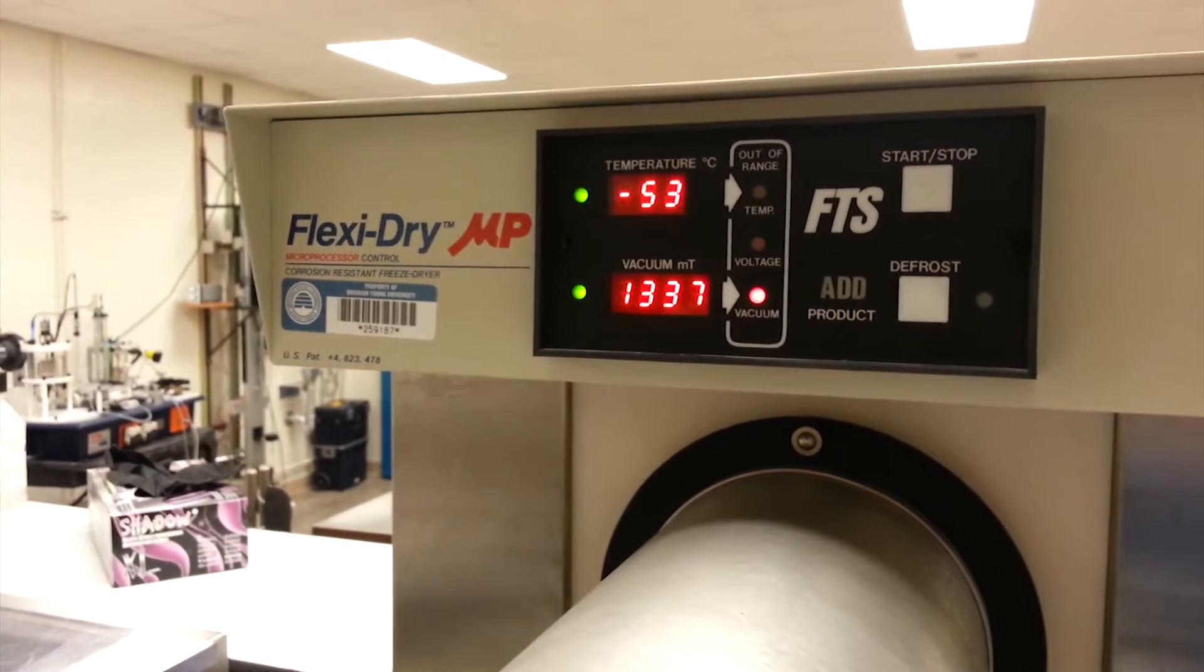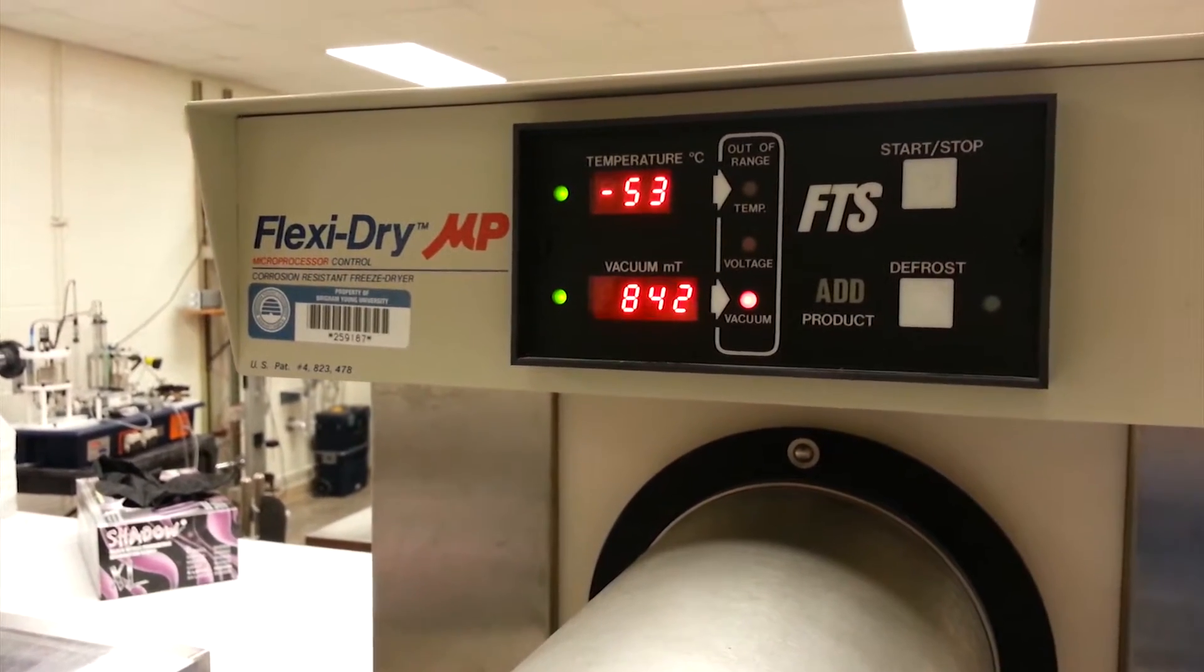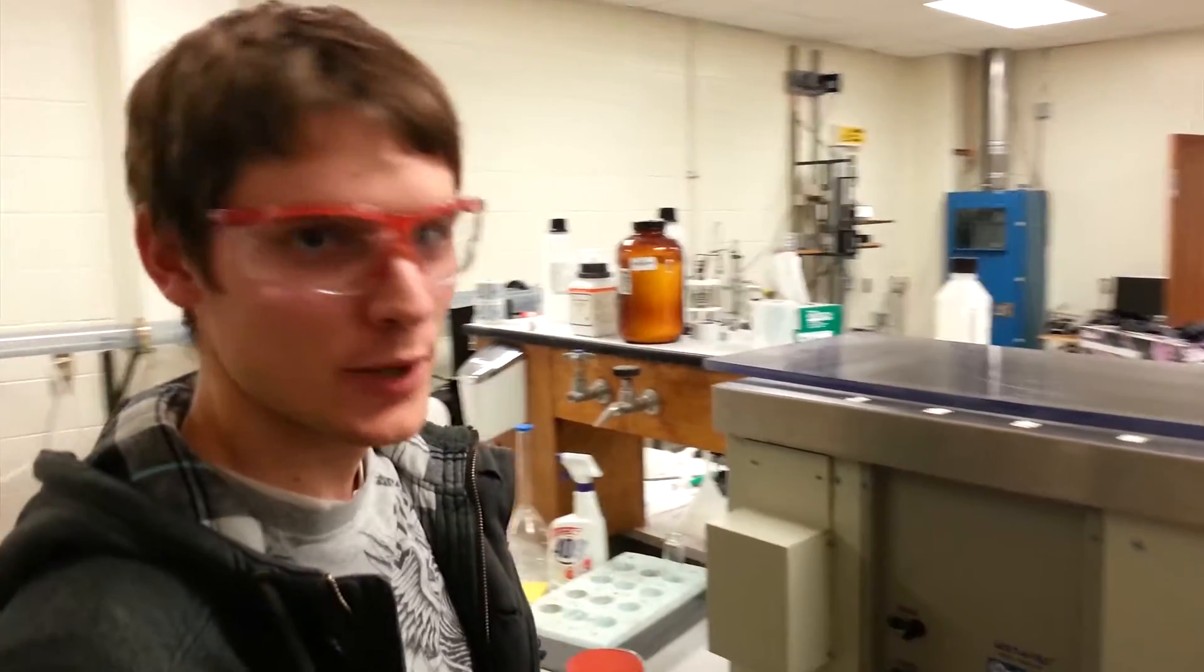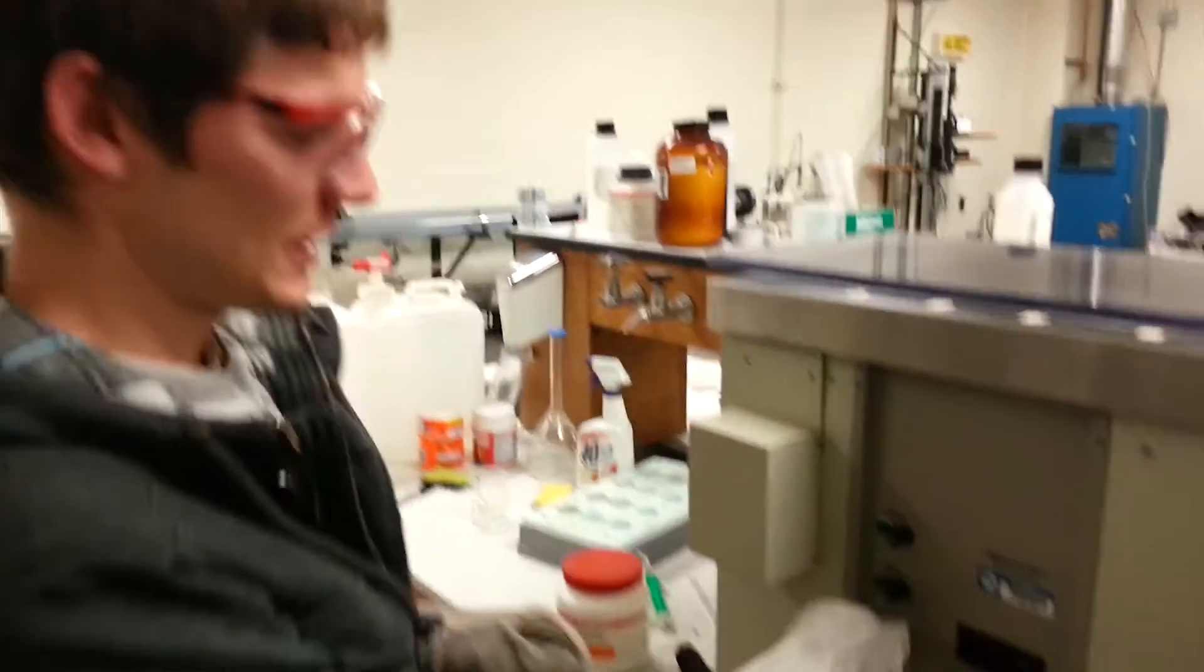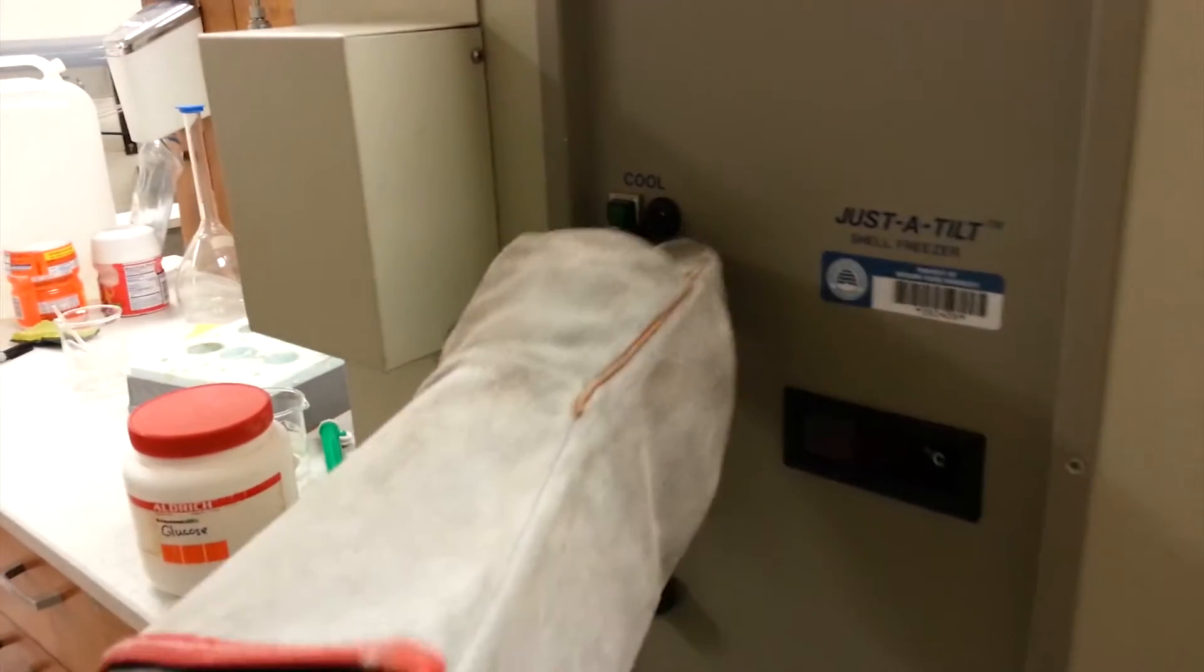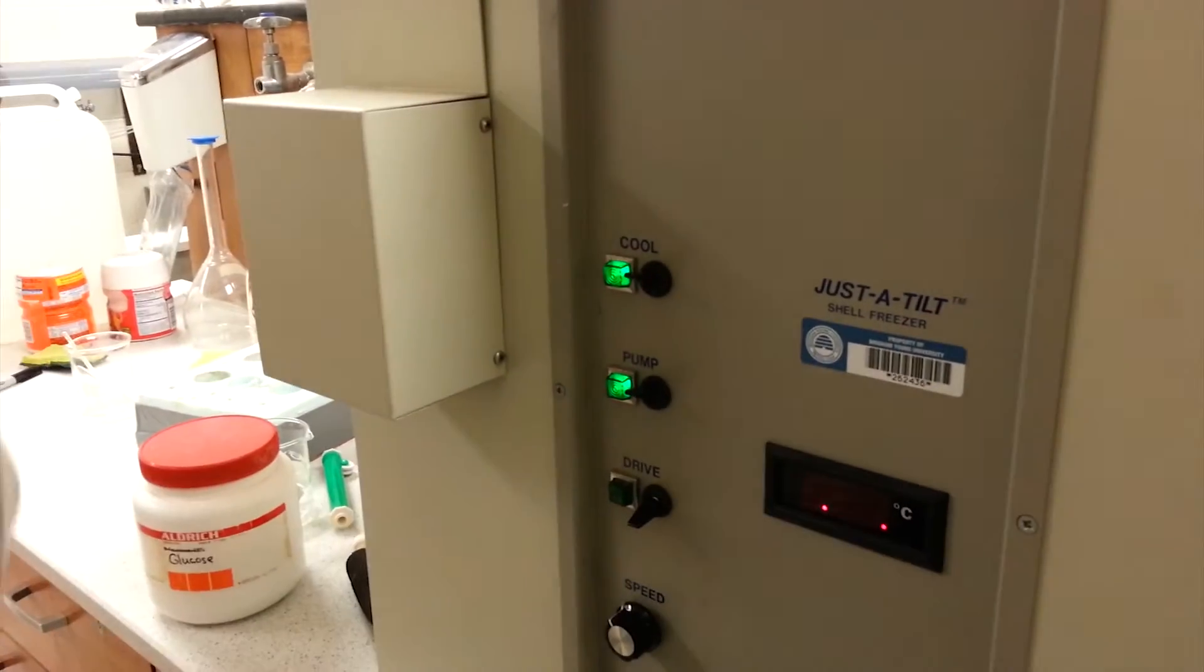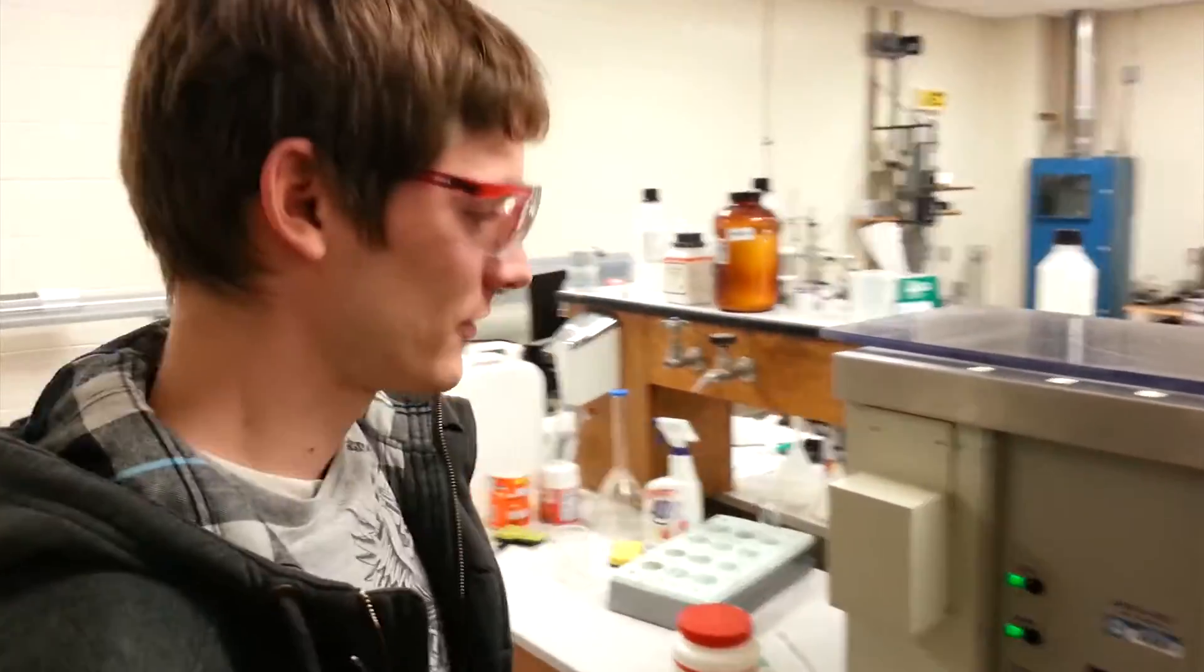And it'll get below usually 400 and that's what it's supposed to be at. So at the beginning of every experiment, we have to freeze the samples. And so we'll turn on both the pump and the cooling to cool down the ethanol mixture that's inside the bath here.